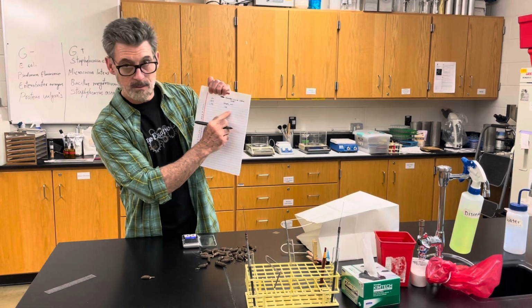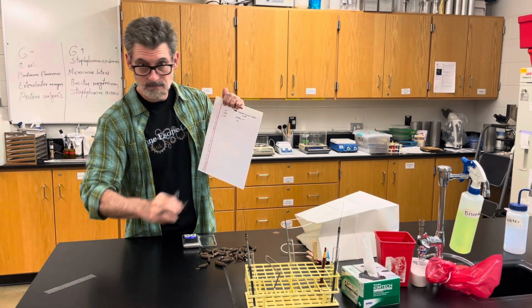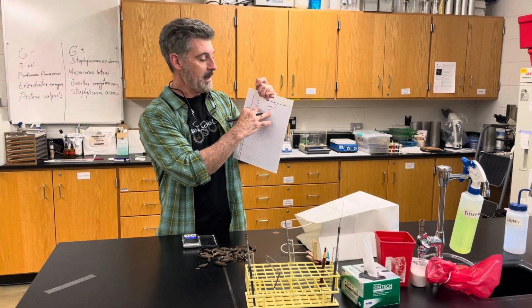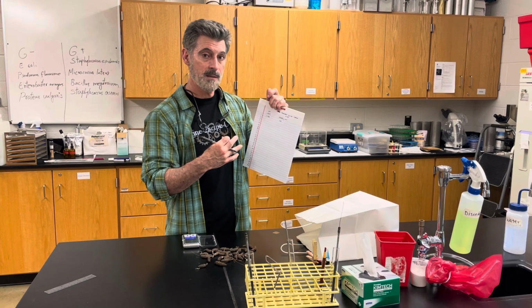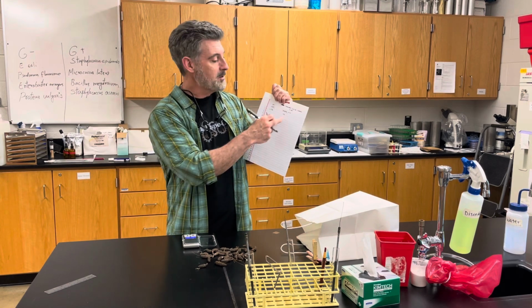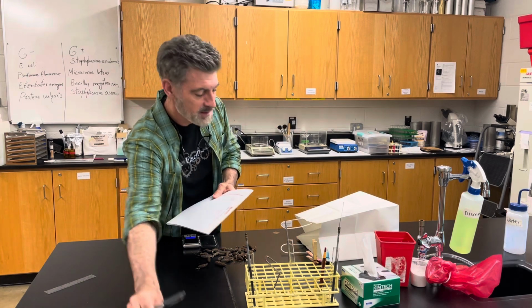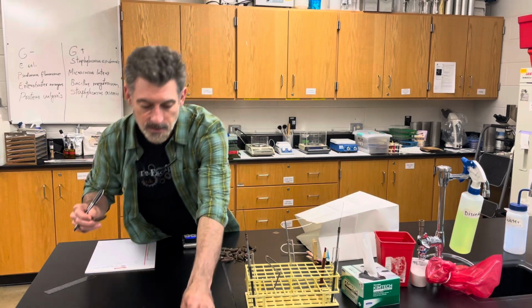So make sure you keep them paired. It's important that they're paired up. You don't do these at two different points in time, because you're going to need to graph these points versus one another in a scatter plot to look at a relationship. There's actually three different graphs you're going to make from this one data set. You're going to be looking at the distribution of the weights, the distribution of the lengths, and then comparing, seeing if they're related, the length to the weight. So when you're done with one, put it aside or have a separate container so you don't redo the same one.